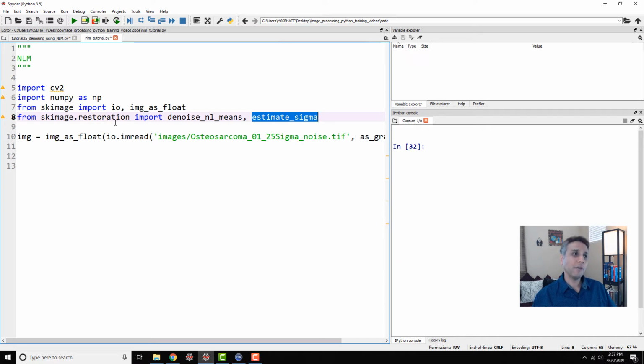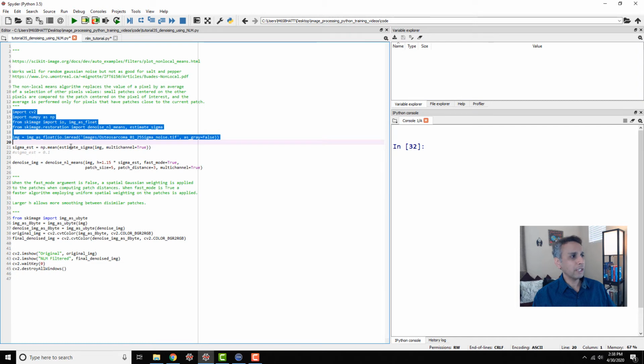Now, as part of non-local means, one of the parameters we are going to provide is sigma. To that, you can just provide a sigma value if you know where to start, or you can estimate the sigma based on the image and give that as an input value, okay? That's the reason I am importing that. Everything else should be pretty standard, right? I'm going to import NumPy. We'll see why I imported that in a second, and OpenCV and others. Okay, so what are we going to do next?